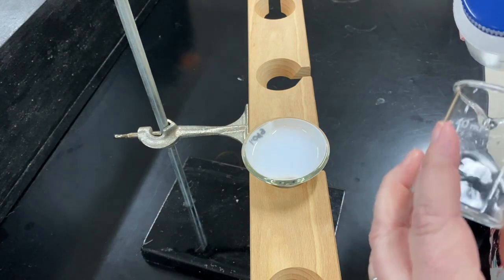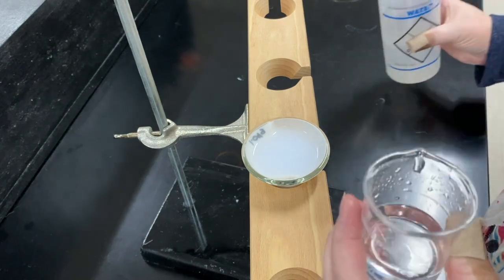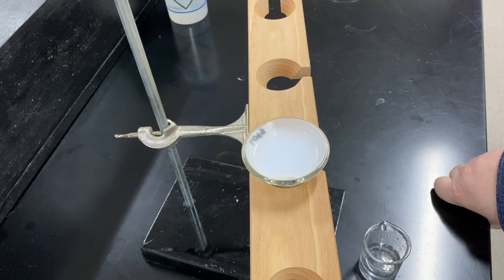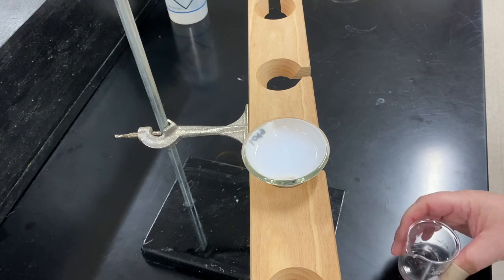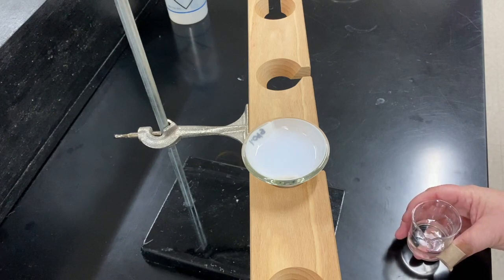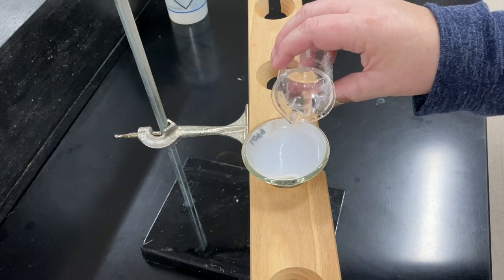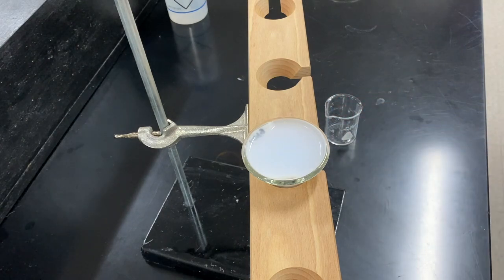The amount of water does not matter because this precipitate is what we call insoluble, which means it will not dissolve in water. I'm going to let a little bit more filter before I add the rest of this. I'm trying to catch all the precipitate that we can. So what we're going to do is we're going to allow that to filter through. It will take a little bit of time.